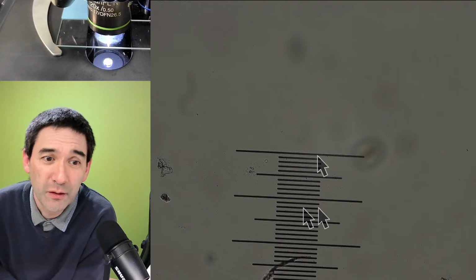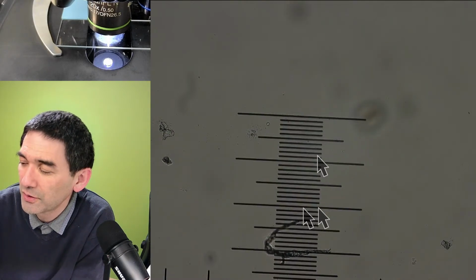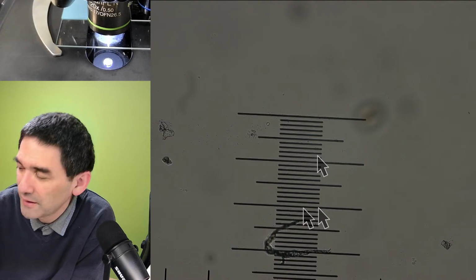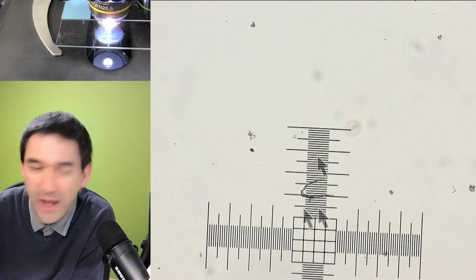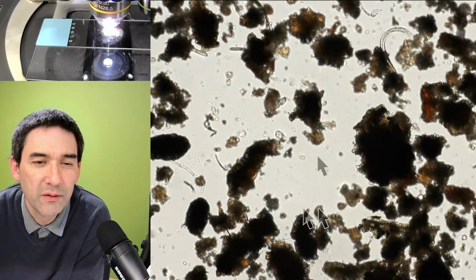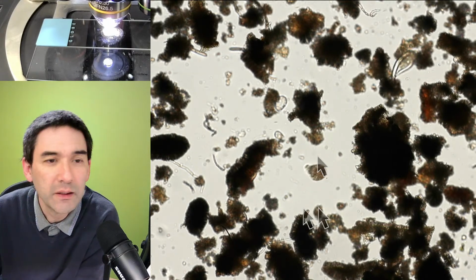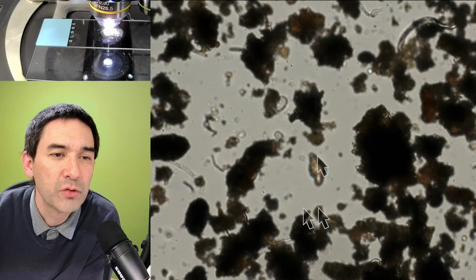Yeah. 1/10 of a millimeter. So that's basically approximately the size. Yeah? So these micrometers. Here we are again. So I have to refocus. So lots of things. I personally have to tell you, I'm a little bit surprised always that these critters are able to survive the dry moss.